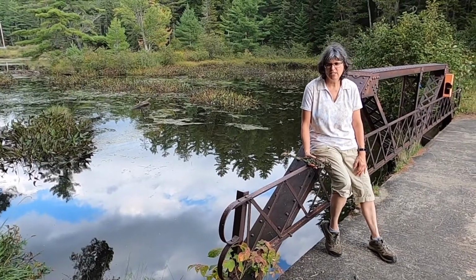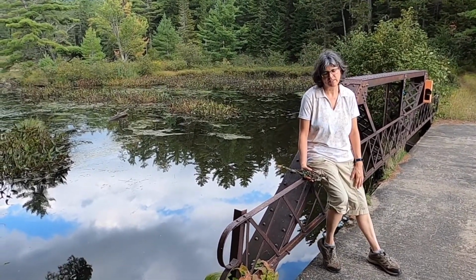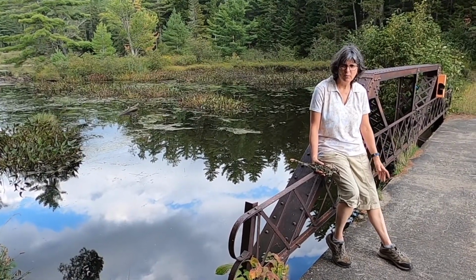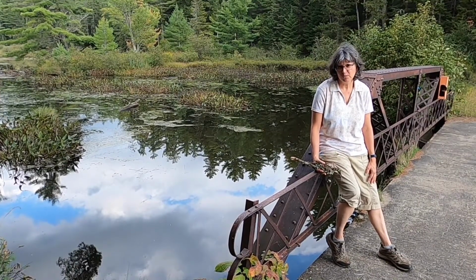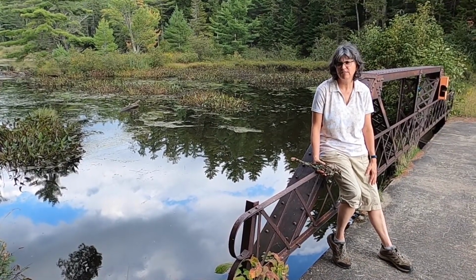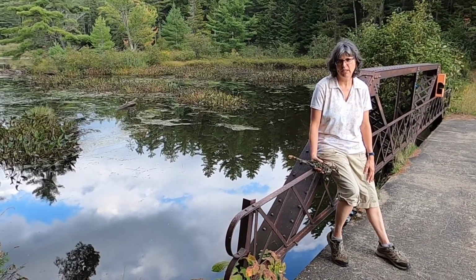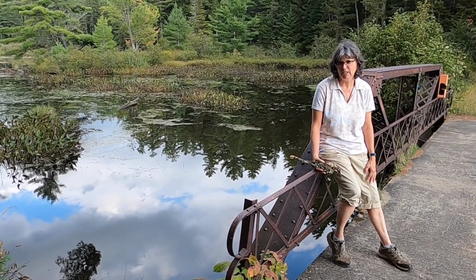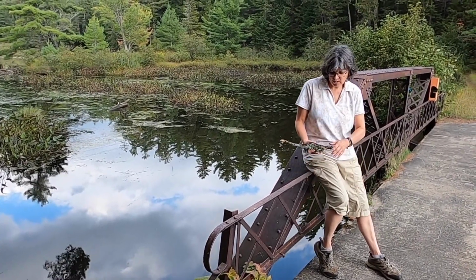It can be challenging to find examples of the fruiting bodies of ascomycetes because they're not mushrooms like we normally think of fungi fruiting bodies as being, and a lot of them are disease causers, but there are a couple that we can consistently find in this area. And so I wanted to show you the fruiting body of what's called the black knot fungus that commonly is found on cherry trees. And so here I've got an example.